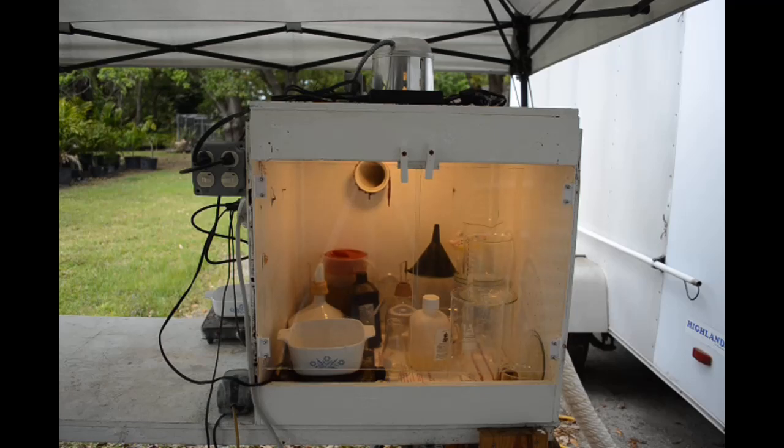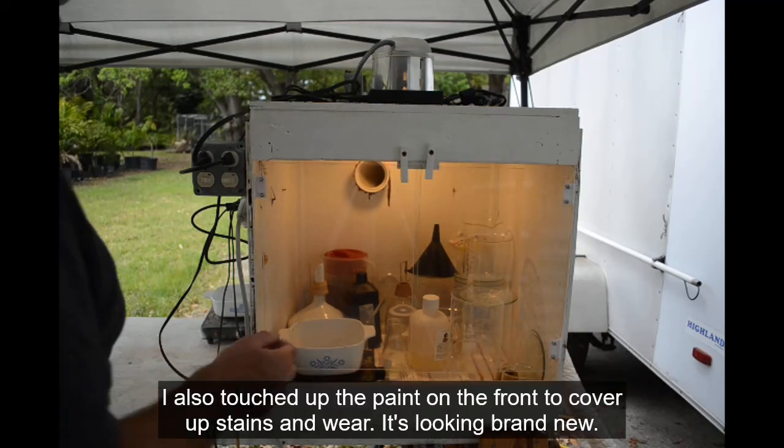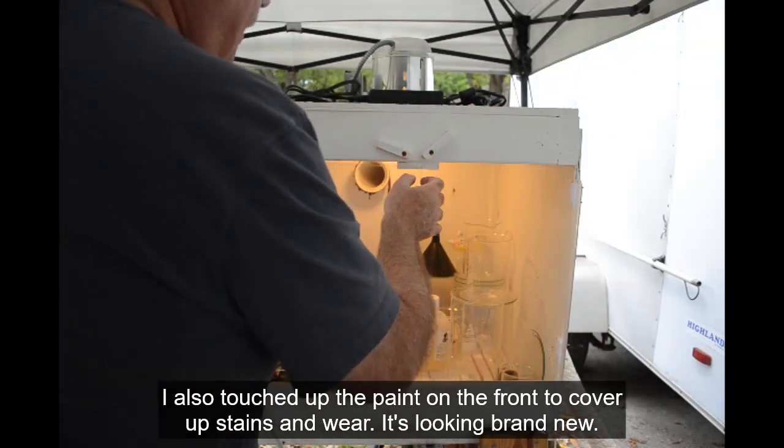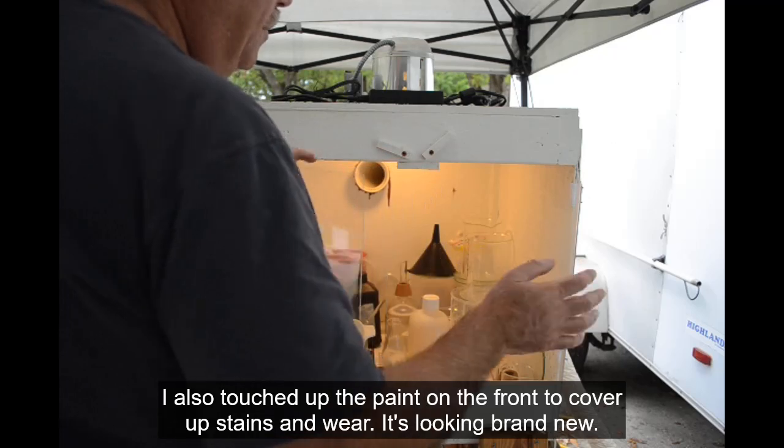I've still got some issues with it but still have a list of things I want to do to modify it. I just put these new doors on just today, replaced the plexiglass, and I've got them overlapping this time so you can only open one at a time.